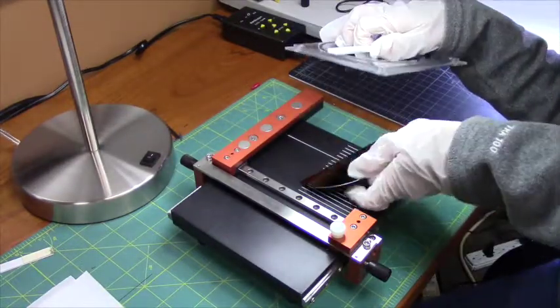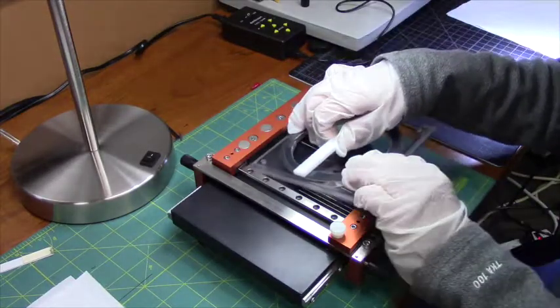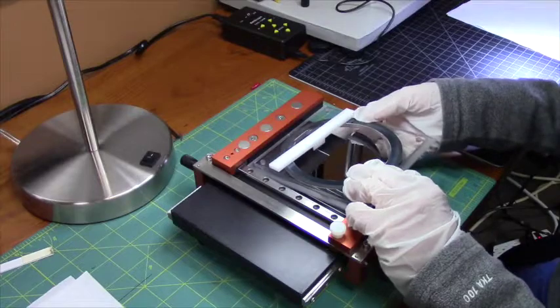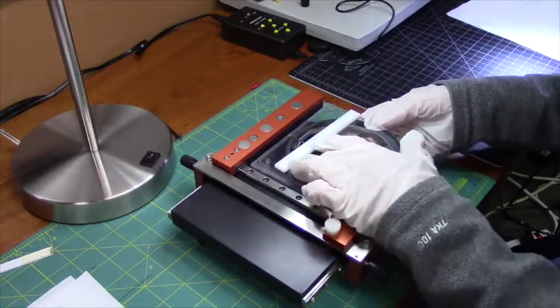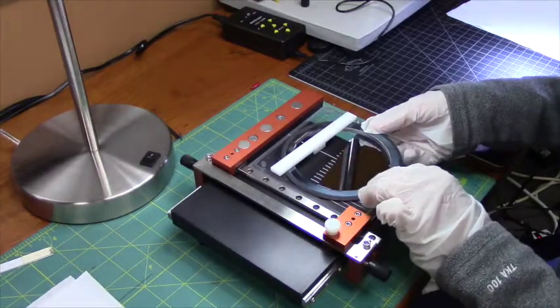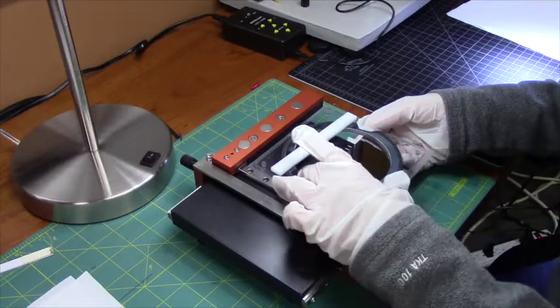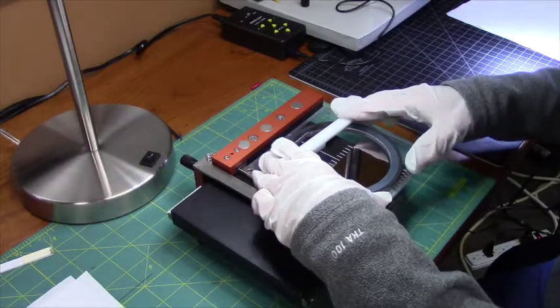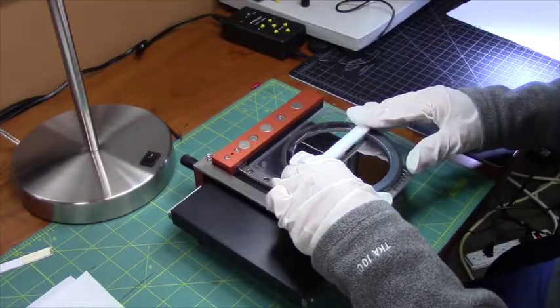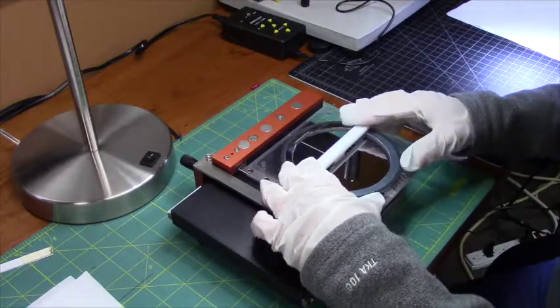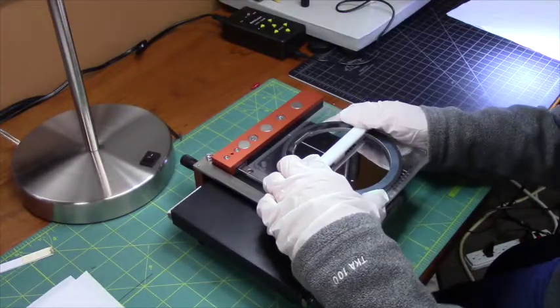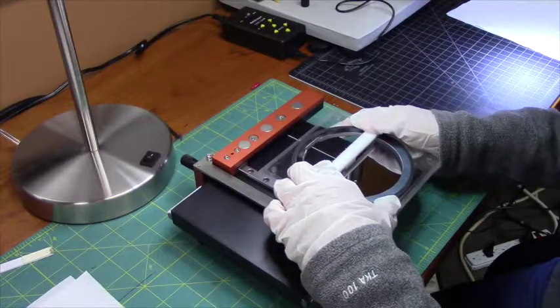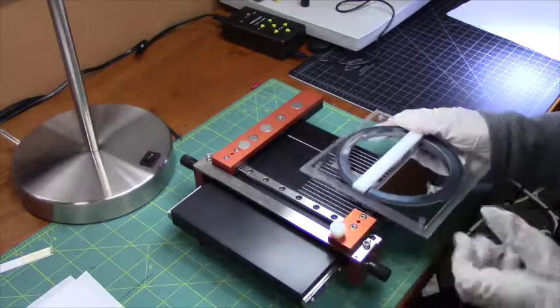This time I will show the sample being loaded. I will place the sample back on to the back of the scribe line. I'm going to repeat that same process of sliding the wafer holder over the scribe in one motion.